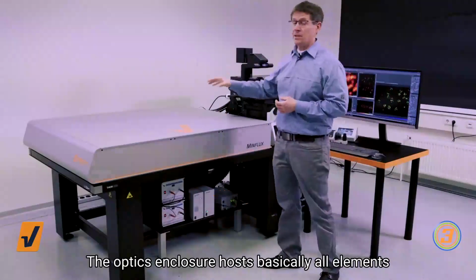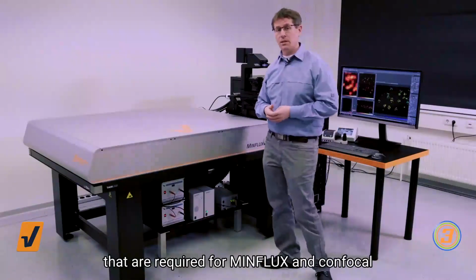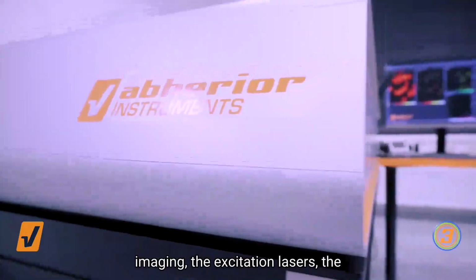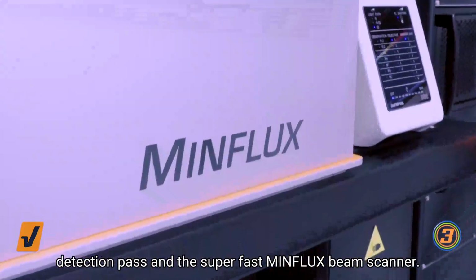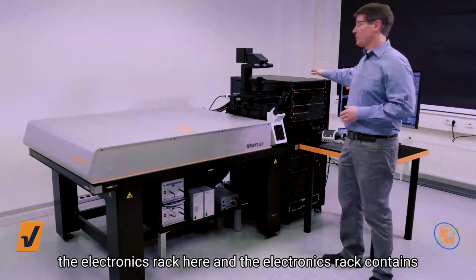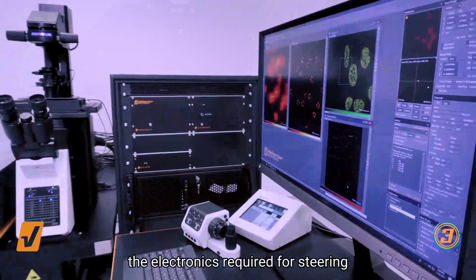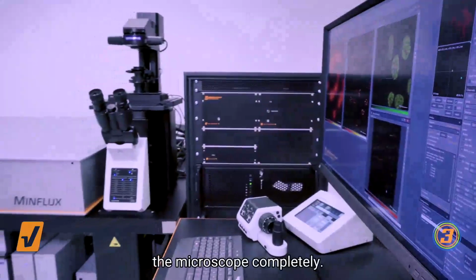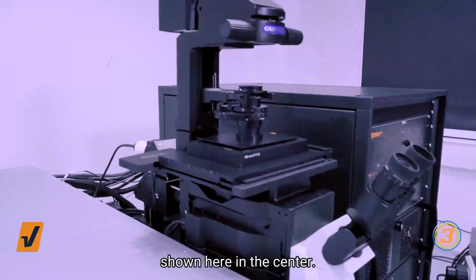The optics enclosure hosts basically all elements that are required for MINFLUX and confocal imaging, that's excitation lasers, detection paths, and the superfast MINFLUX beam scanner. On the other hand, we're having the electronics rack, which contains the electronics required for steering the microscope completely. The last part is the microscope body shown here in the center.